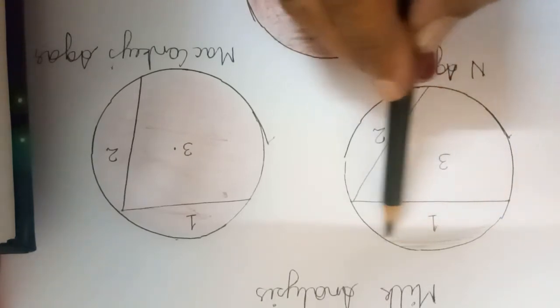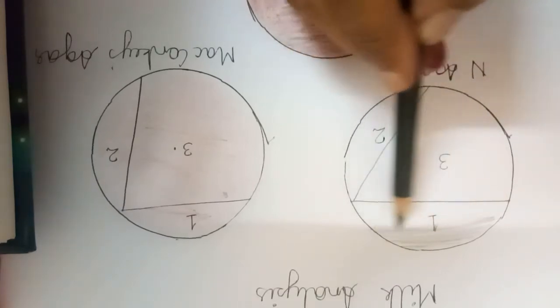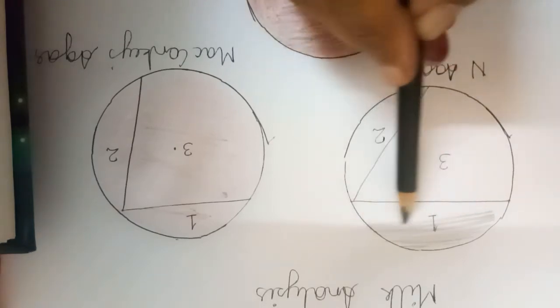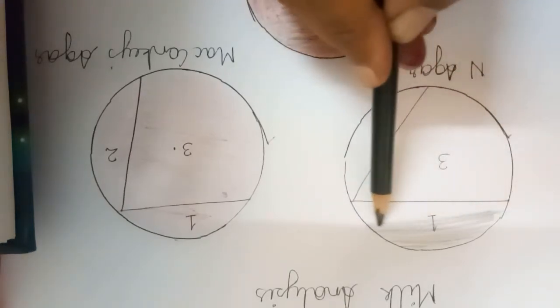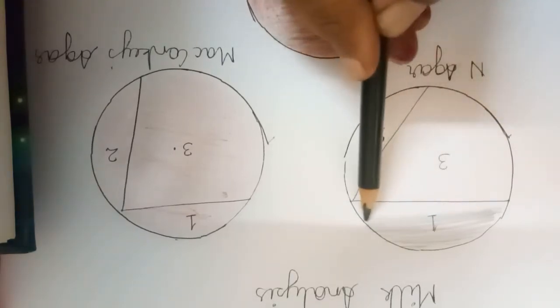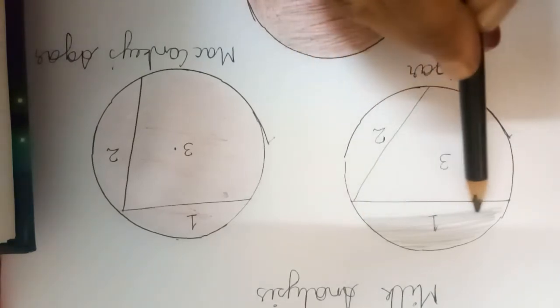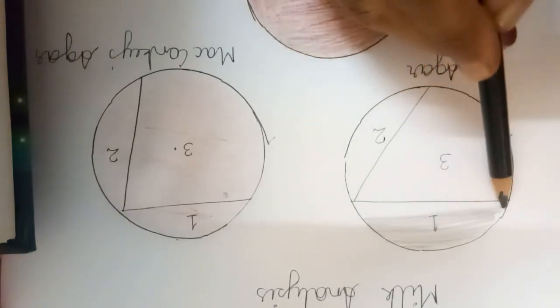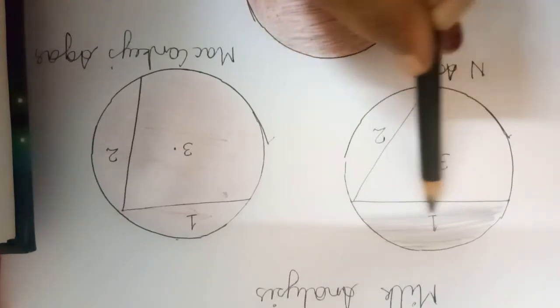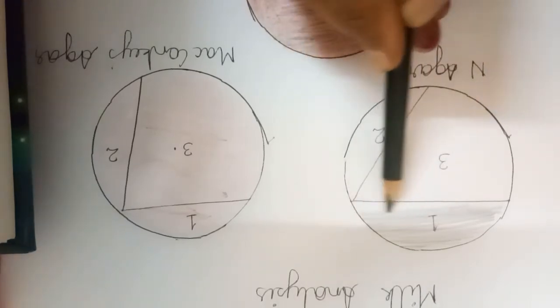This is my nichrome wire. Very slowly and steadily by covering the entire sector. Okay, like this. This way we have to inoculate the agar plate.